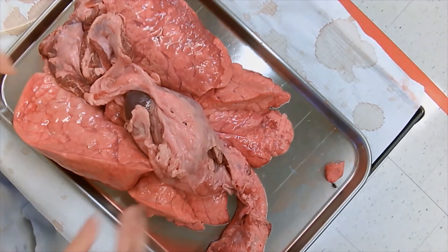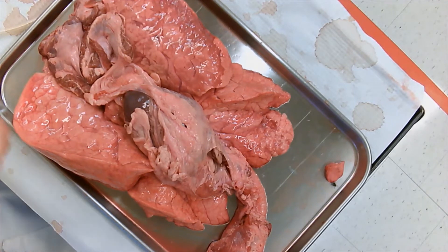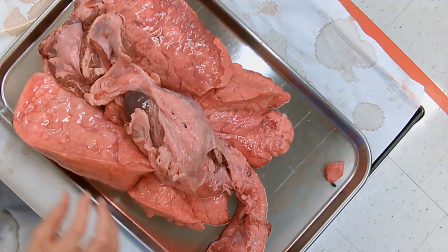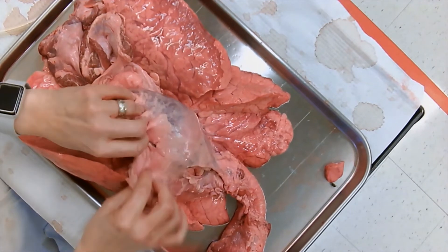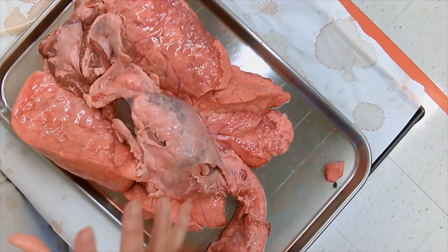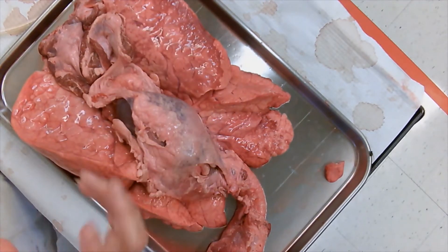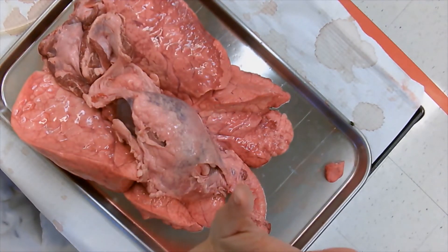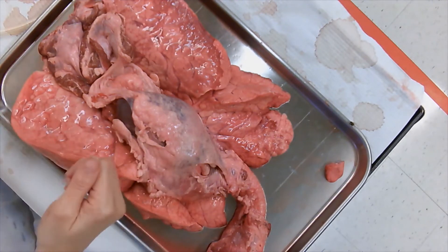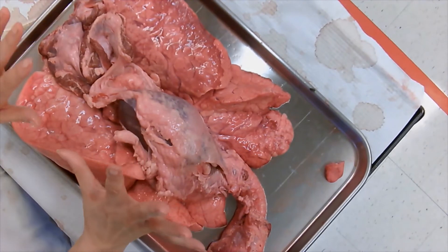This is all connective tissue that actually holds everything in your body in place. When you're standing up you don't want your lungs and heart to sag down, and when you do a handstand you don't want them going up to your head. It's like when you buy a toy in a box and it's jammed in with all the ties — this is what the connective tissue does: it holds everything in place inside your body.